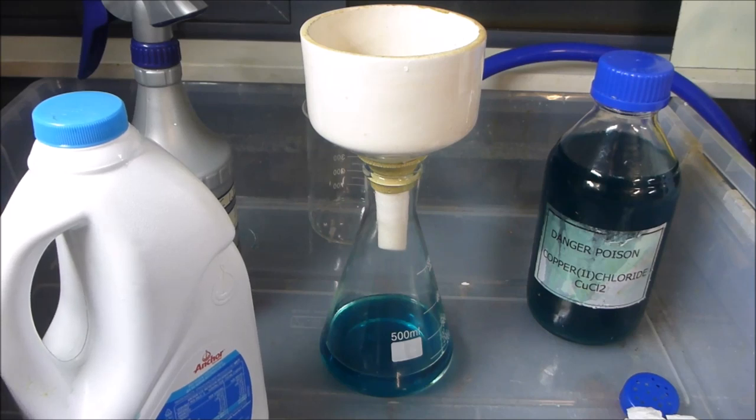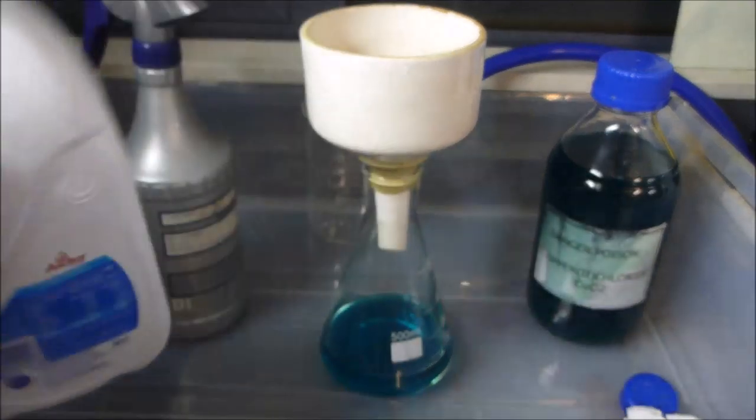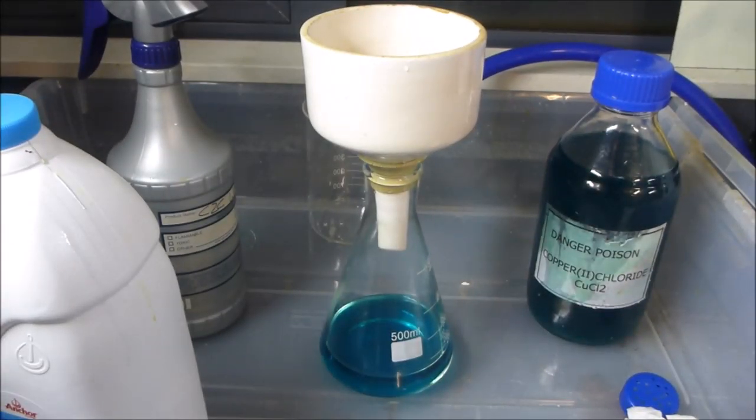The old system where every finger is individually sprayed down to remove every last foil is just crazy. Crazy in terms of the amount of waste that it generates, as well as how long it takes. So this is how I do it. I've had a look at these fingers many times, and they're practically clean. Like, there's the odd foil, but I can live with losing 10 foils if I'm doing it in 10 minutes rather than spending an hour spraying them.